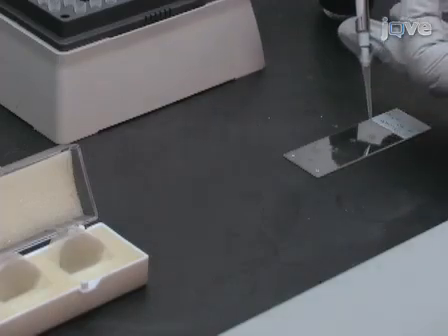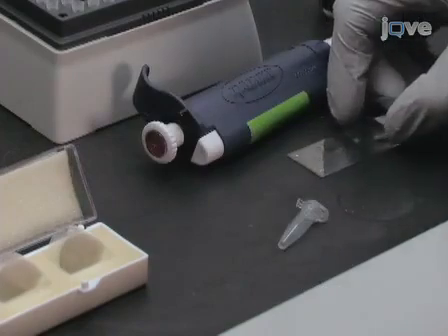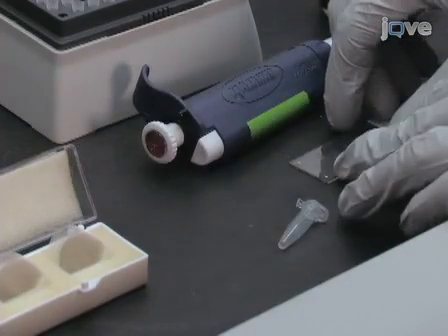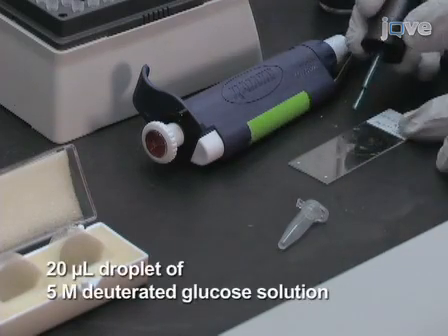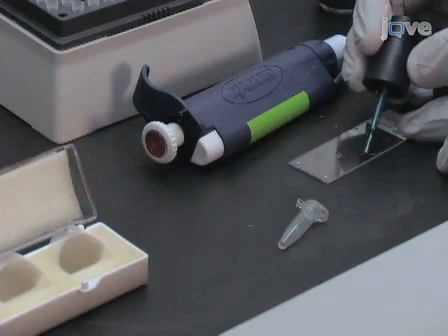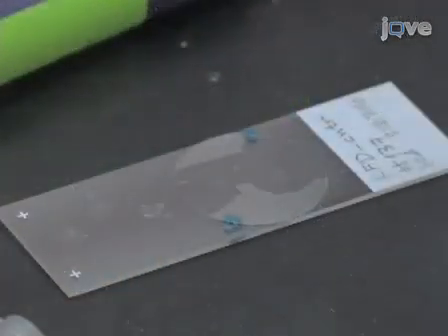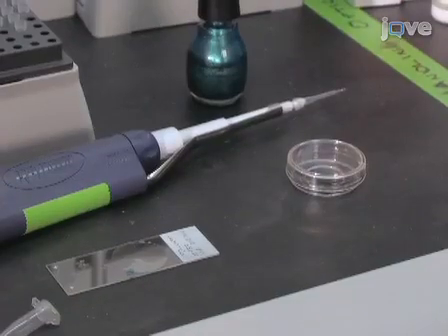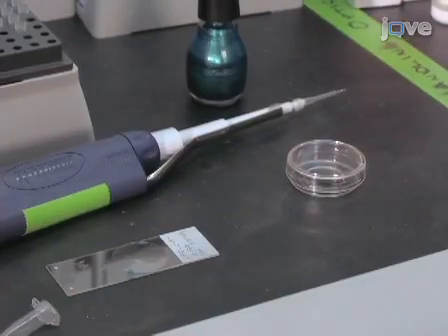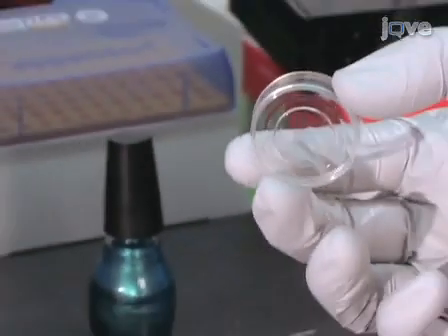To demonstrate the preparation of a typical sample, we prepare approximately 20 micron thick sections of mouse muscle tissue that are fixed to a microscope slide. A 20 microliter droplet of 5 molar deuterated glucose solution is added to the sample. The deuterated glucose solution provides a unique and strong Raman background signature. A glass cover slip is placed on top of the sample and fixed in place with nail polish. For cells in culture, glass bottom culture dishes can be used that allow for imaging without the need to detach the cells from their cell culture growth dishes.